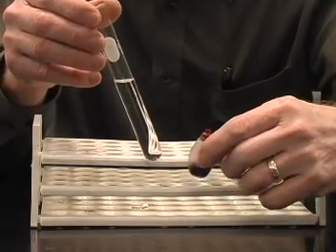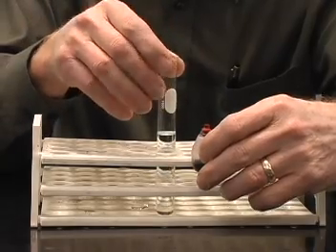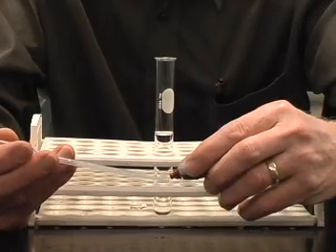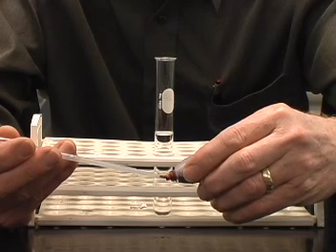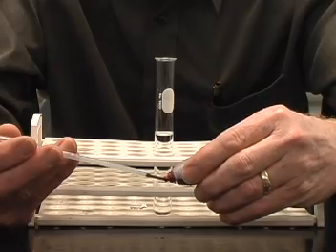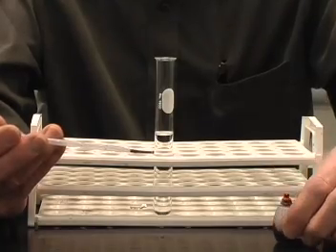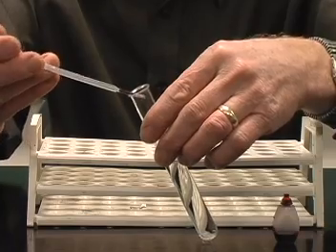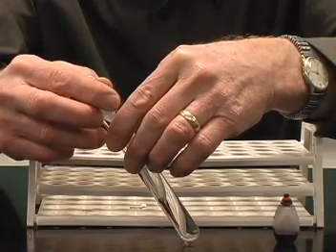I have some red food coloring here, and we can put a drop into the bottom of the test tube using a pipette. So what I'll do is draw up a little bit of the food coloring into my pipette and then drop that into the bottom, delivered to the bottom of the test tube.